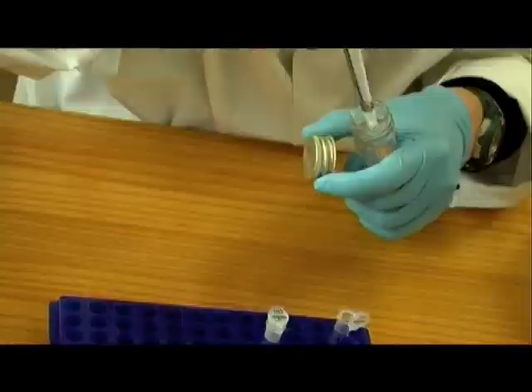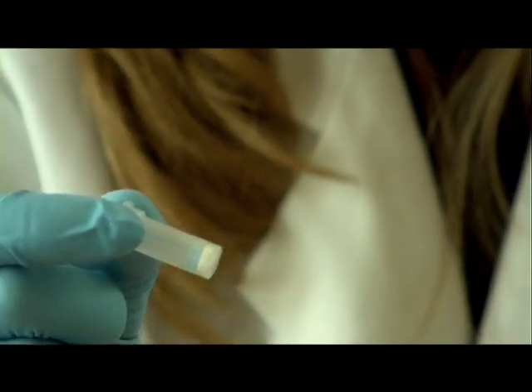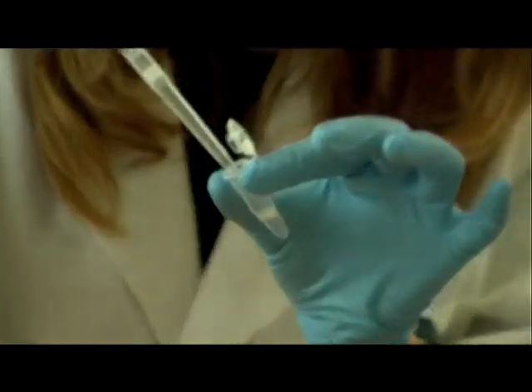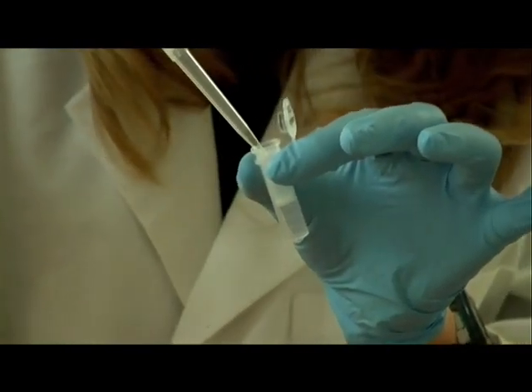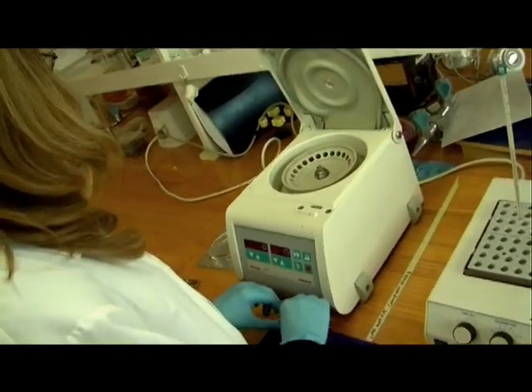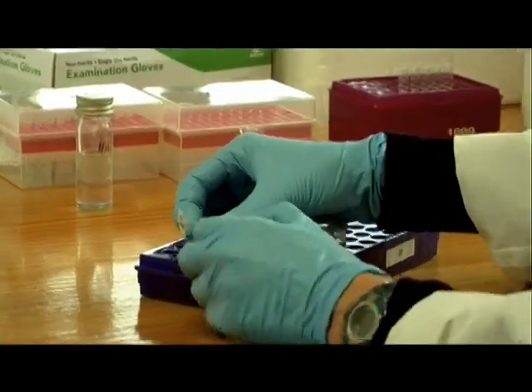Once the tissue is completely digested, isopropanol is added and then the solution is put into a purification column. In the column is a thin layer of silica matrix, like a filter. Because DNA is a charged molecule, it will bind to the silica matrix under certain salt conditions. The isopropanol provides the chemical conditions that ensure the binding of the DNA. The column is centrifuged, which forces the solution through the silica matrix. The DNA will bind to the silica, while the cellular debris will pass through and can then be discarded.